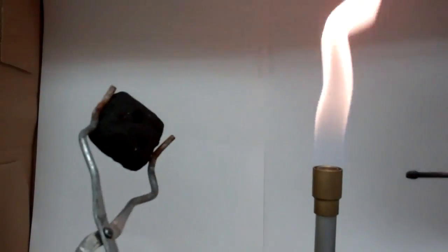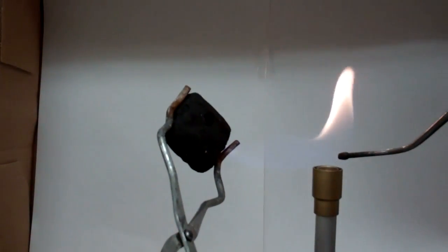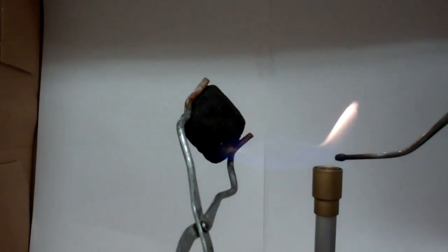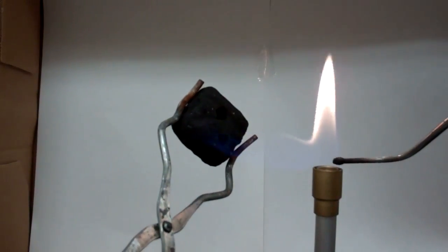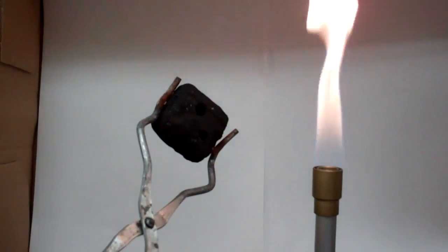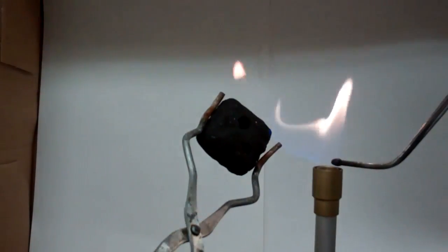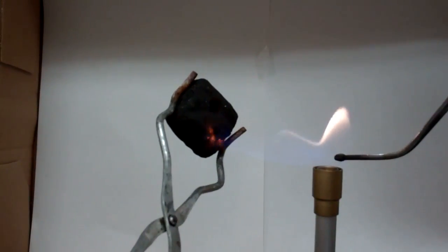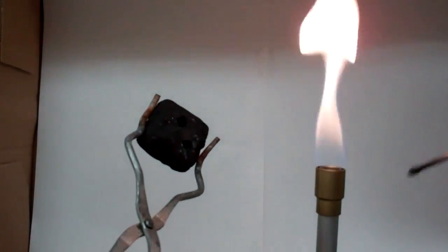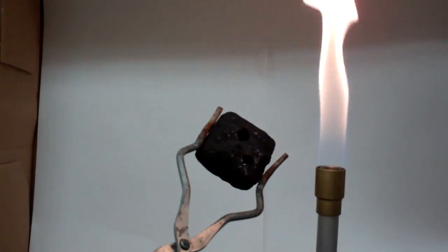Okay, so I'm going to angle my briquette just right. And sometimes you have to take a break to catch your breath. You want to heat this for about a minute. And once it starts bubbling up, I think it's kind of doing right now.